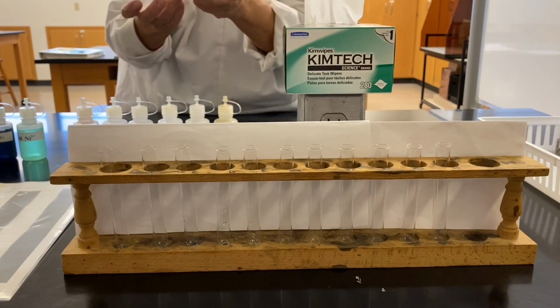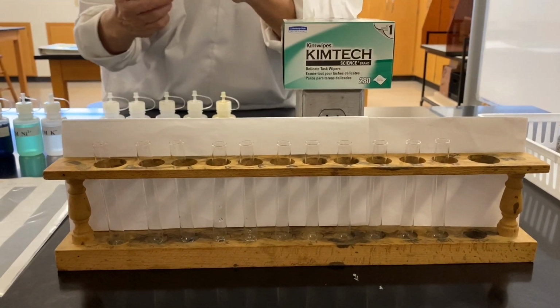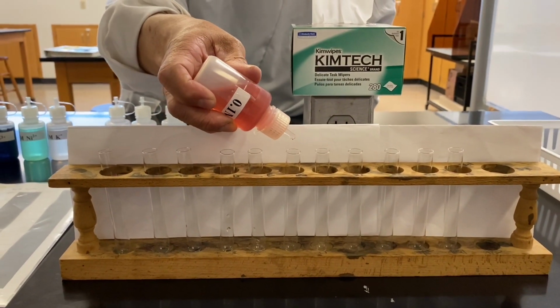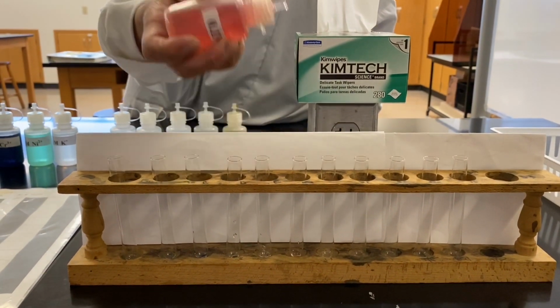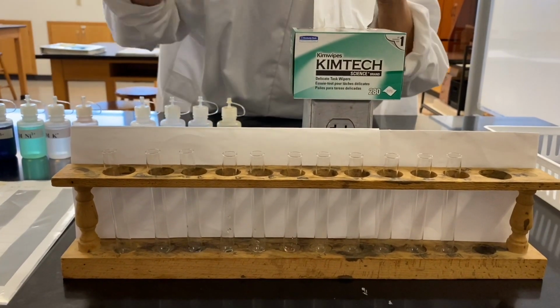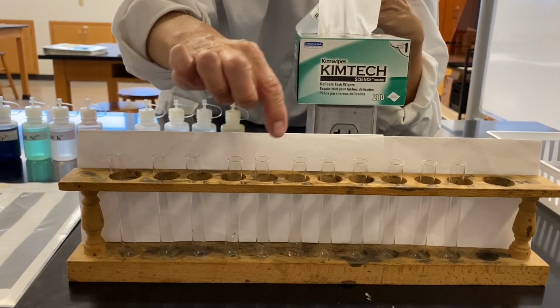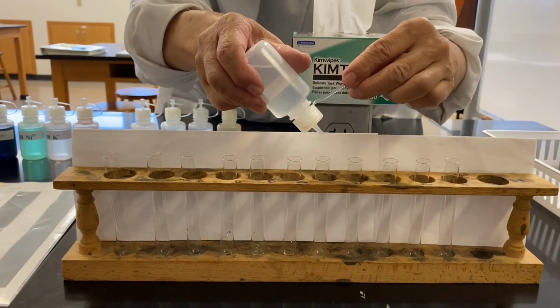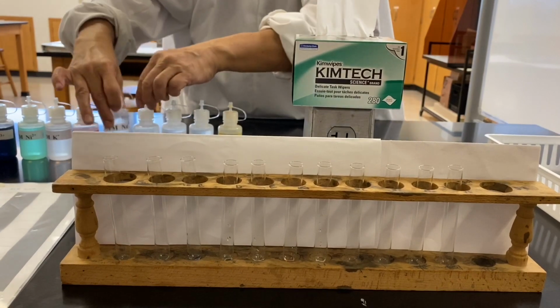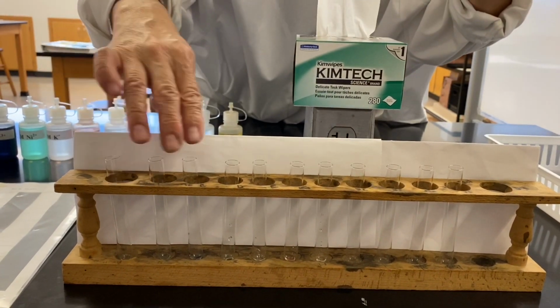This is because ammonia has a very pungent smell. Hence, we will perform reactions with ammonia in a test tube. You will add 1 drop of the metal cation solution in one tube and 2 drops of ammonia.